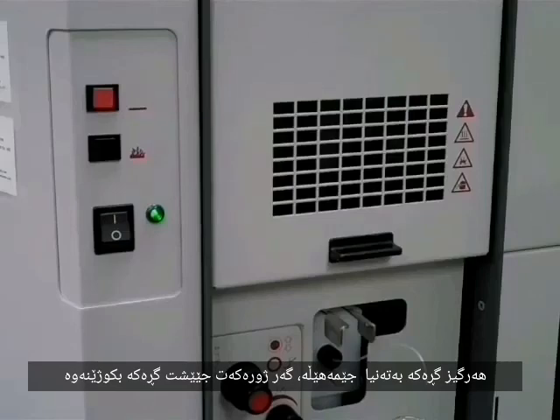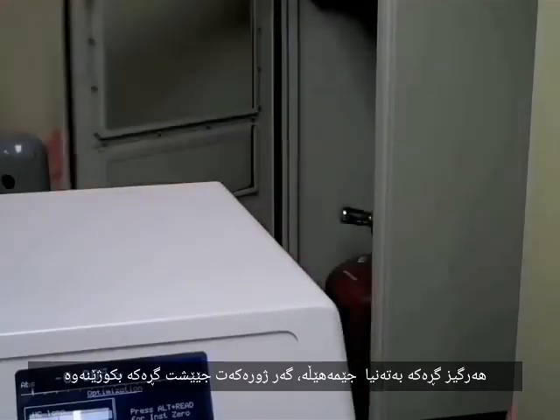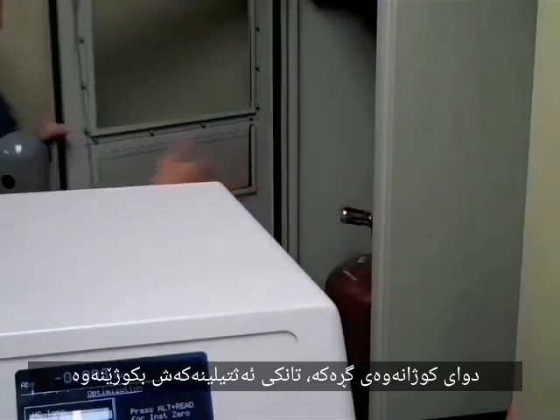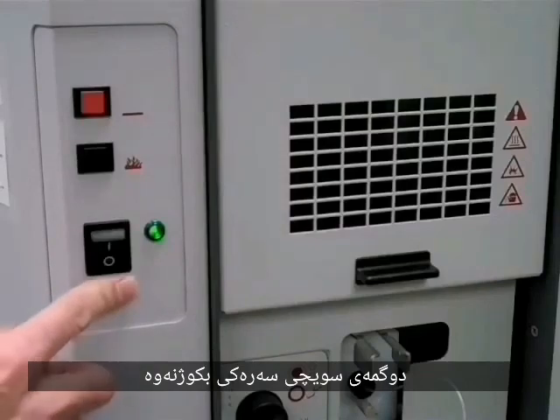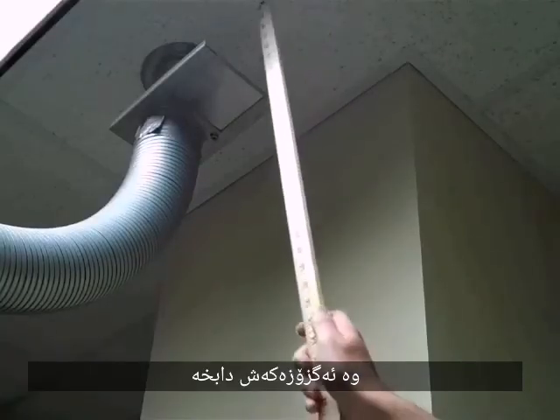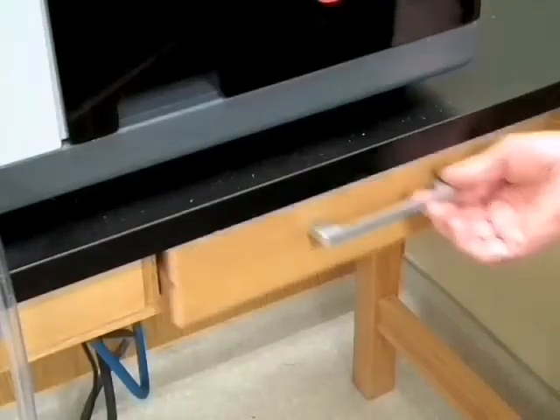Never leave the flame unattended. If you leave the room, turn the flame off first. After turning off the flame, turn the acetylene off at the tank. Turn the main power switch off. And close the exhaust vent. And sign the logbook.